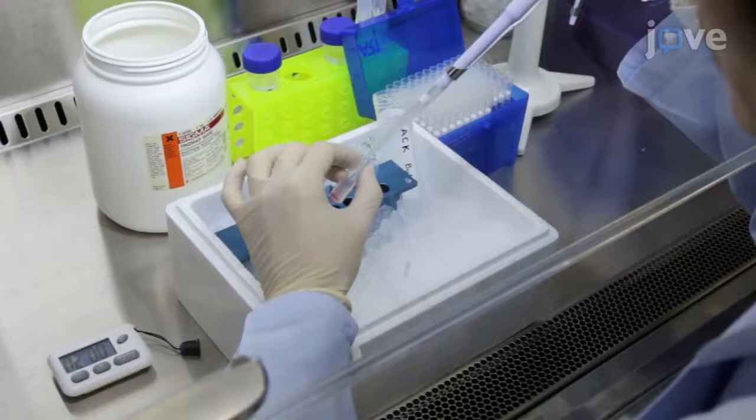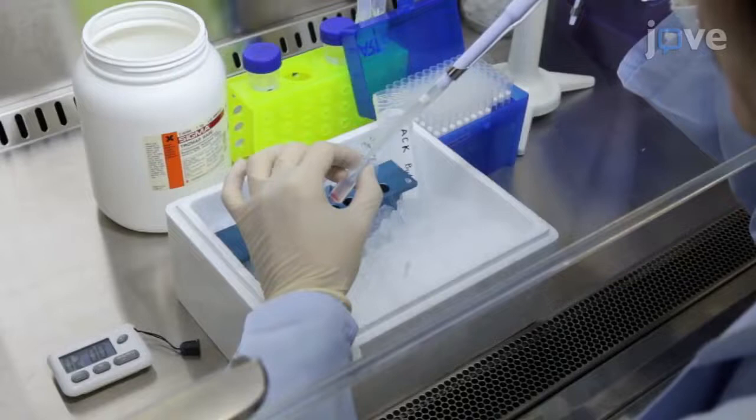Discard the supernatant and add 800 microliters of ACK lysing buffer to the pellet. Incubate on ice for two minutes to lyse the red blood cells in the tissue.